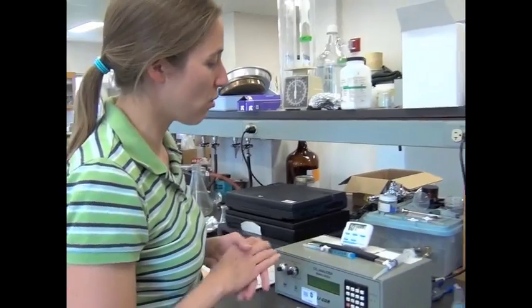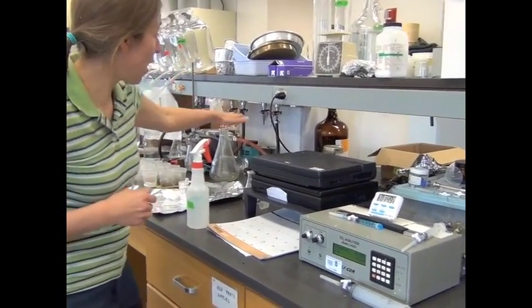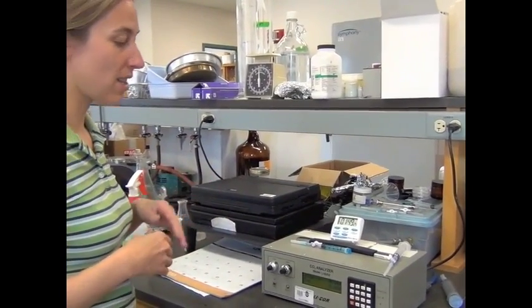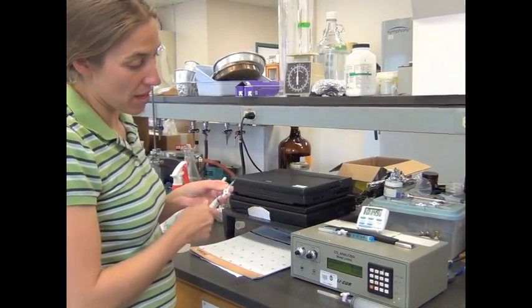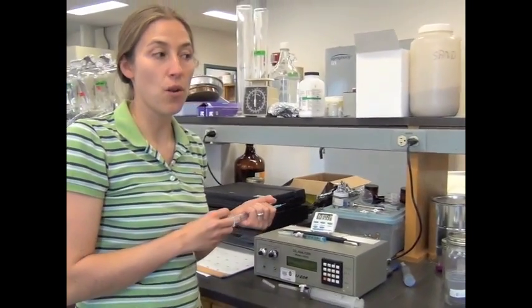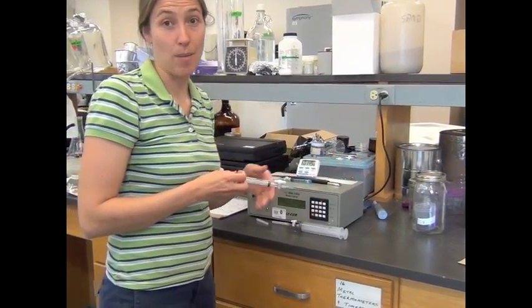So we're going to measure the CO2 concentration in our jars using an infrared gas analyzer. Prior to this, I turned on the air for this instrument, because there's always air that flows through, and I let it warm up for 15 minutes, so that's already done. Now we're going to do a standard curve, so that if we put a known amount of gas in, we know what the reading is for that known amount. We have a tank of known CO2 that I will inject at different amounts, and that's where we'll make our standard curve, so we can determine the concentration of our unknown gas.